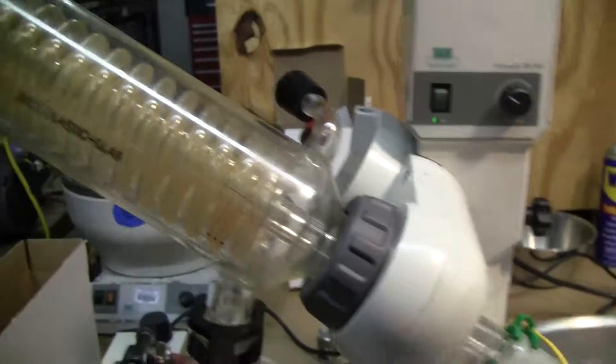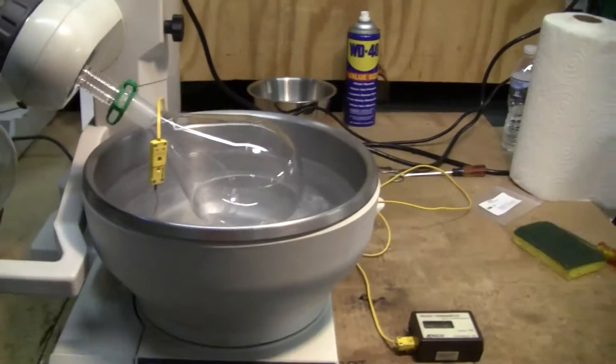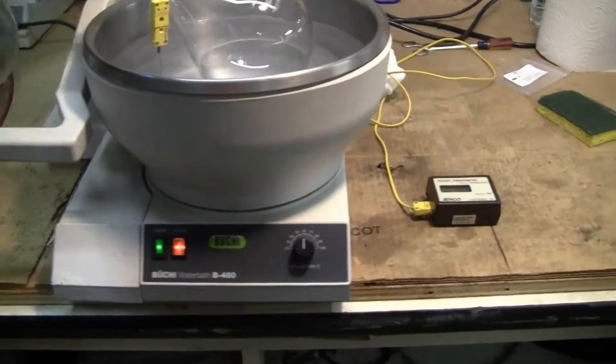We have it under vacuum and it is running. The bath is holding temperature.